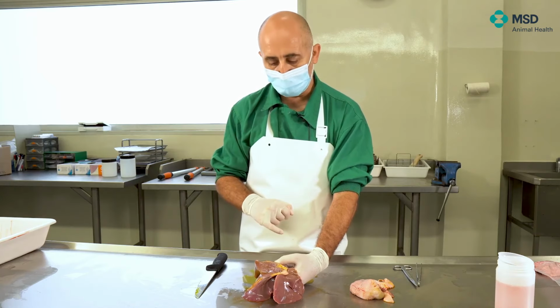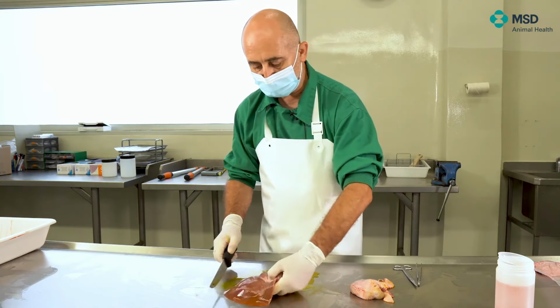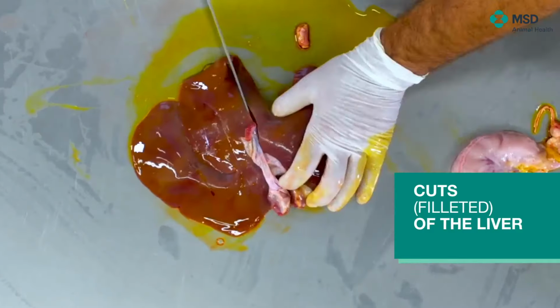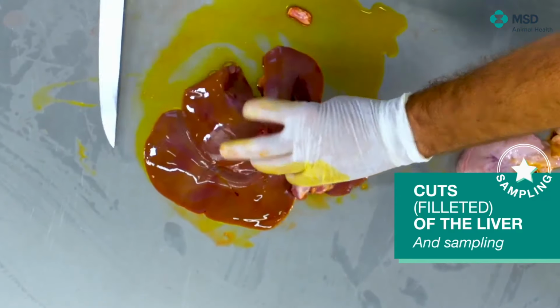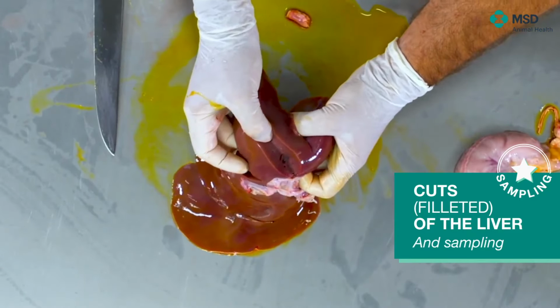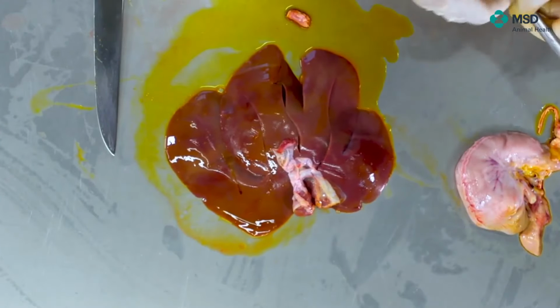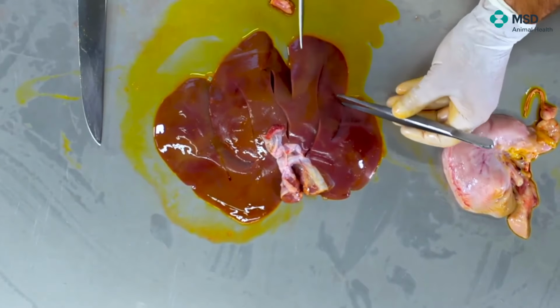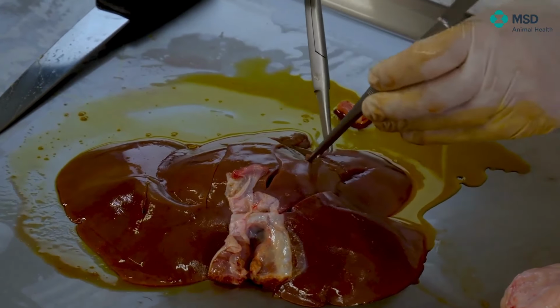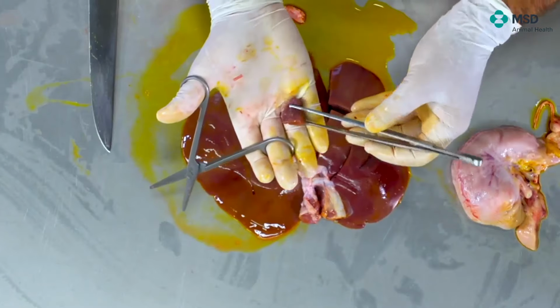Okay, and in terms of liver, there's not much to be seen grossly. What we usually do is several cuts in the different lobes, basically in order to be sure that the parenchyma looks normal. Sometimes we push a little bit to see the consistency. If we have to take a sample for histopathology, then the sample could follow the same examples that we have seen before: small pieces, in general terms, relatively easy to be fixed, as we see here.